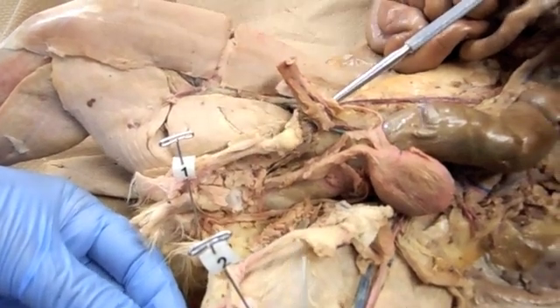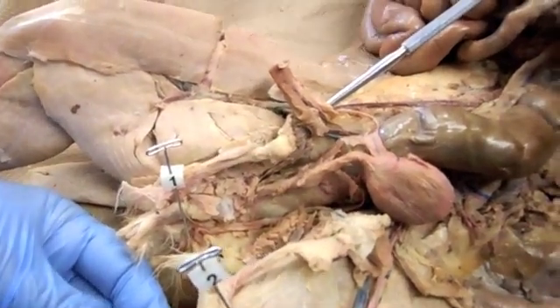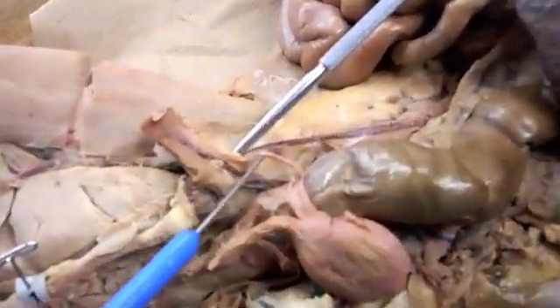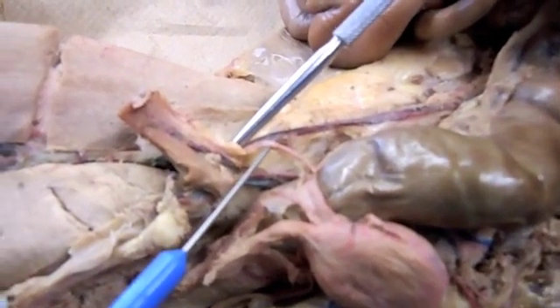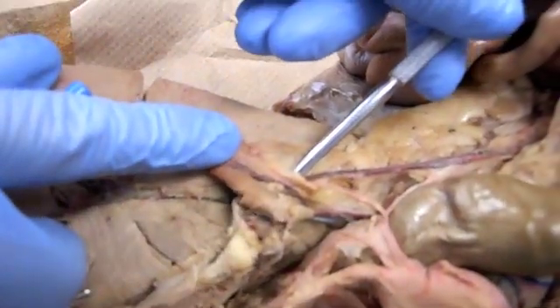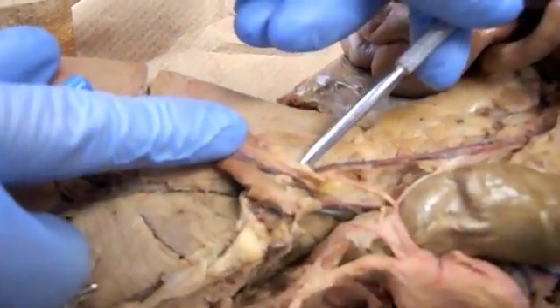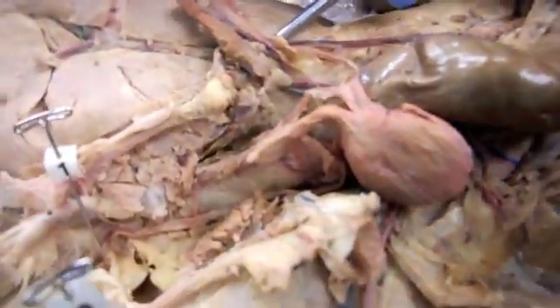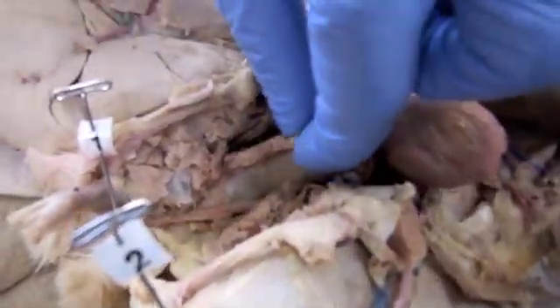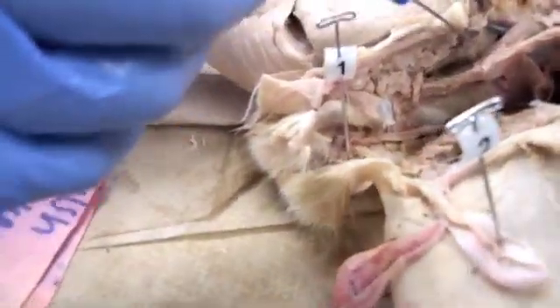Ryan has the ductus deferens. The inguinal canal is where we have it probed right now. The prostate — it's going to be kind of hard to see it, but you can feel it; it's a hard knot in here. And the penis.